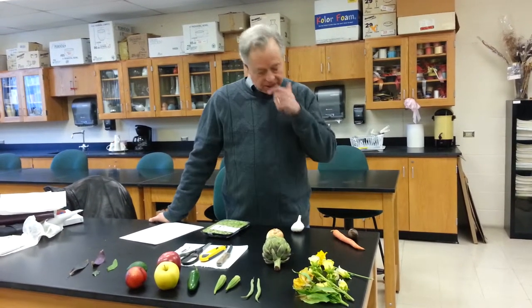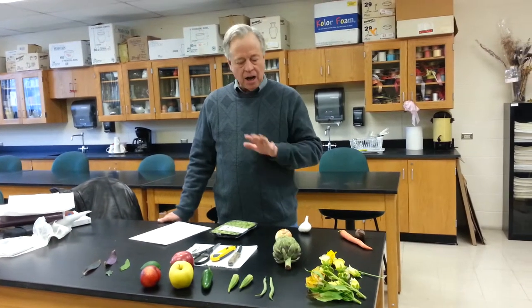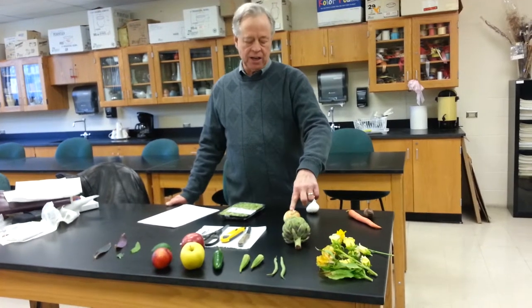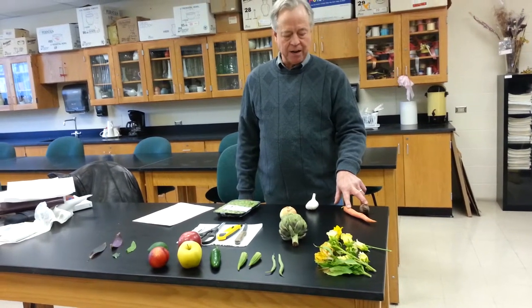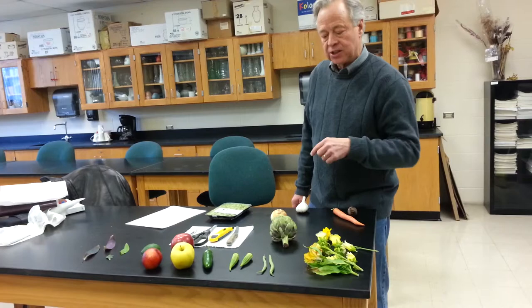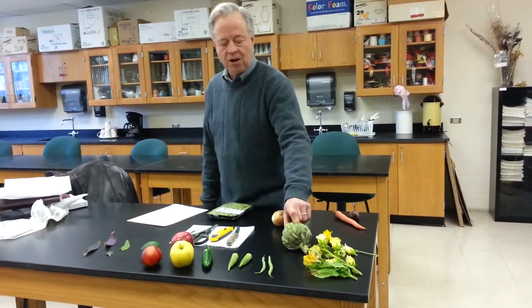What we have on this table here is a variety of different plant organs. We have lima bean seeds, we have an onion stem, we have a garlic bulb, we have carrot and beet roots, we have a variety of flowers here, and we're going to practice a dissection on a flower in a moment. We have an artichoke, which is another flower structure.